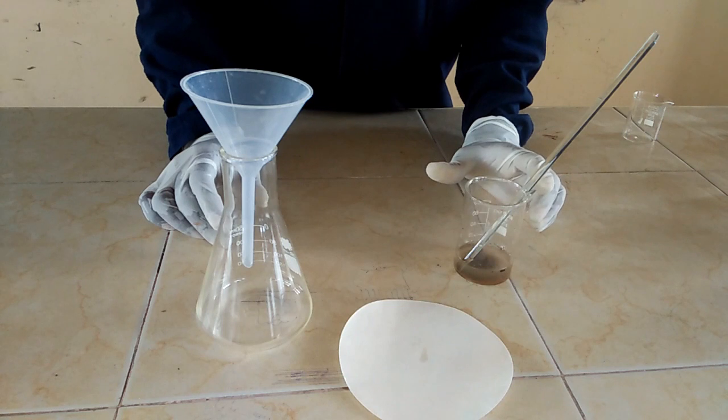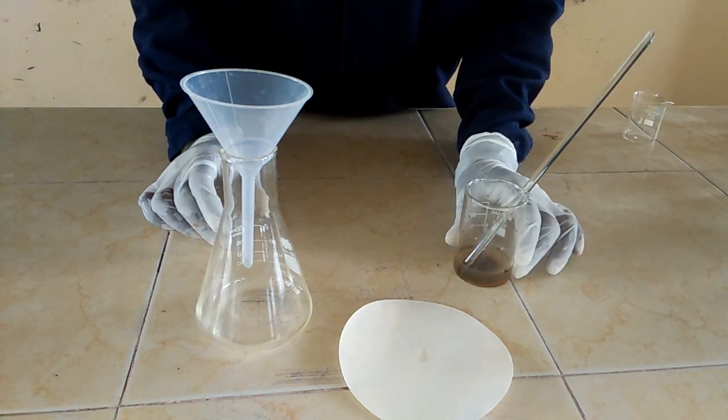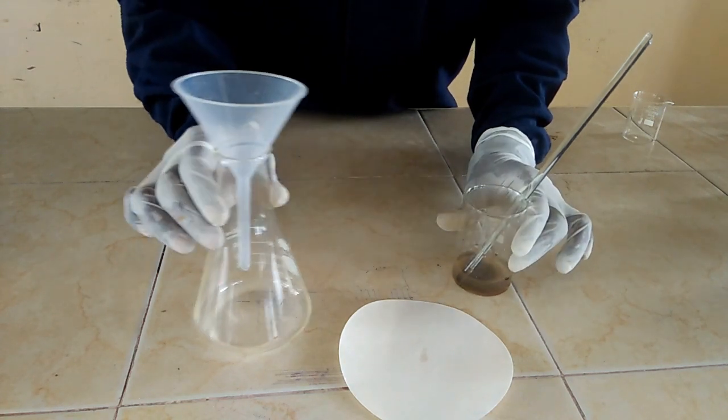I am going to explain how to separate a mixture of insoluble solid and liquid using the filtration method.